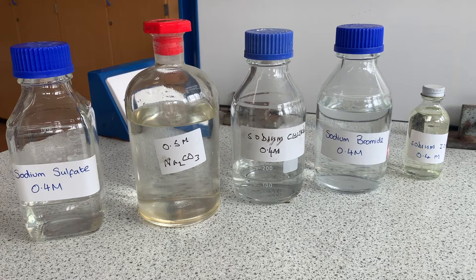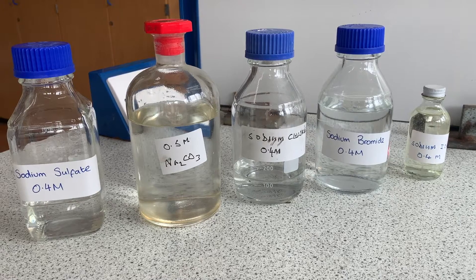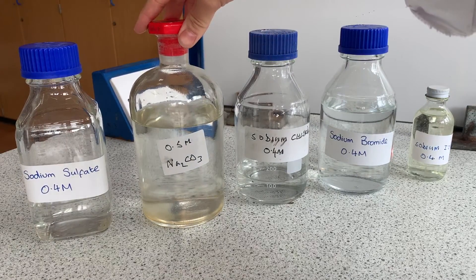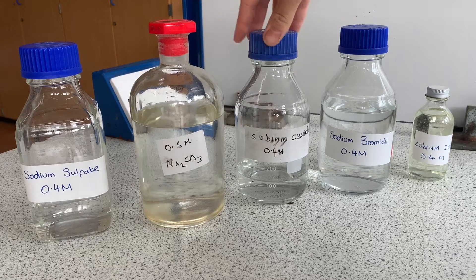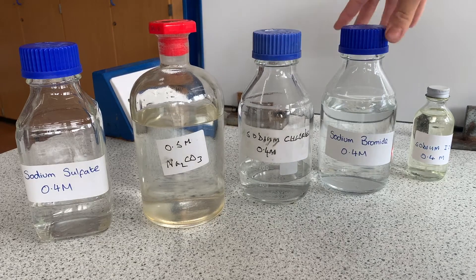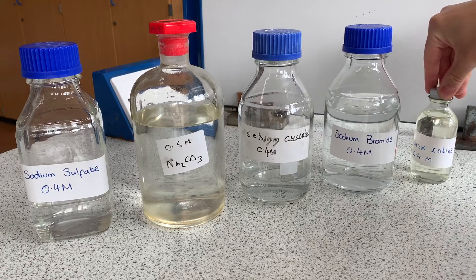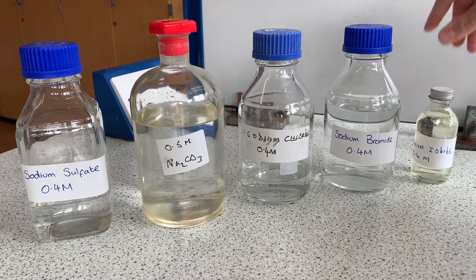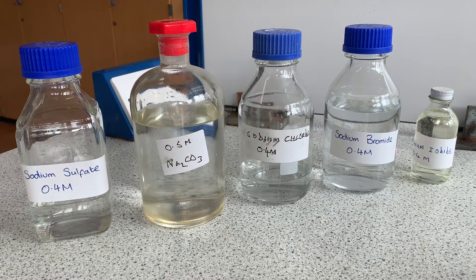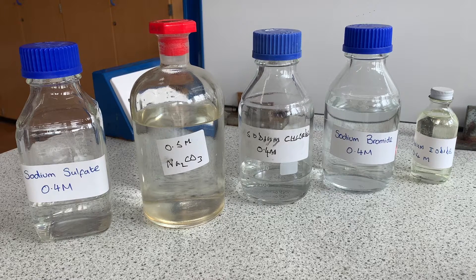Now on to the tests for non-metal ions. I'm going to be testing sodium sulfate, sodium carbonate, sodium chloride, sodium bromide and sodium iodide. You can see all of these salts contain the metal sodium — we're just changing the non-metal this time.